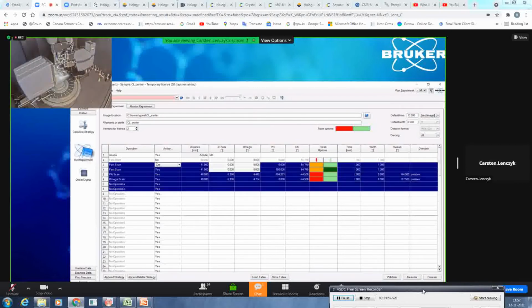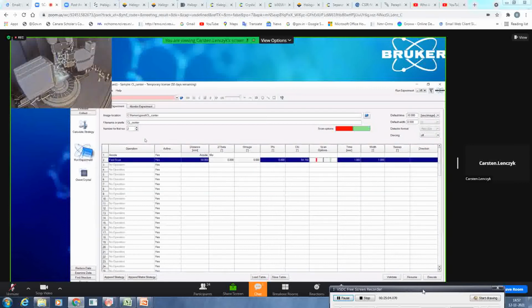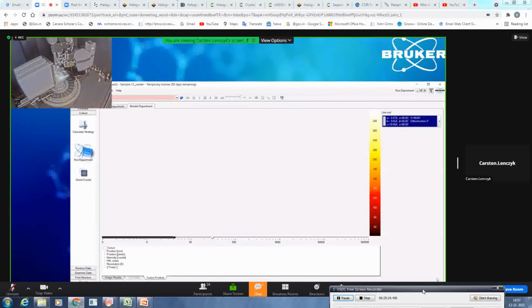So as you see, I had the experiment from yesterday. I will get back to it in a few seconds, don't worry. What I will do then is a fast scan in the sensitive mode and without attenuation. I will come back to that also in a few seconds. And we just click execute because we now want to get a first idea about the diffraction quality of the crystal itself.